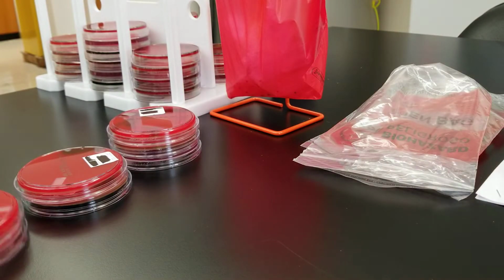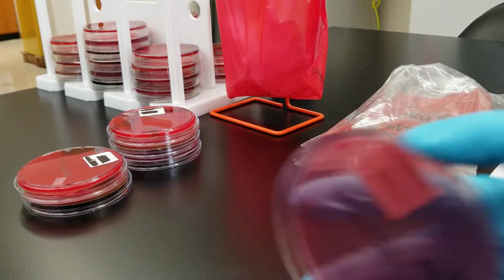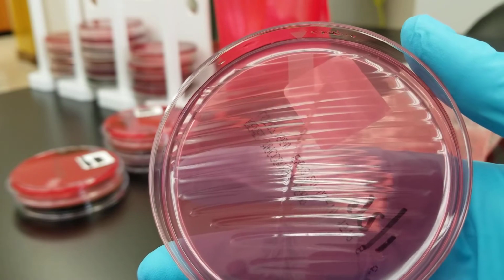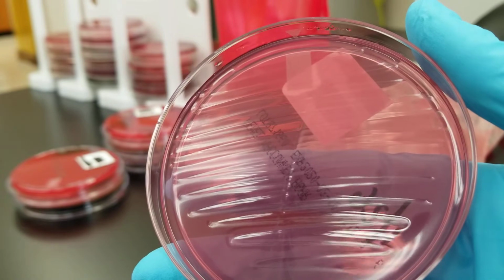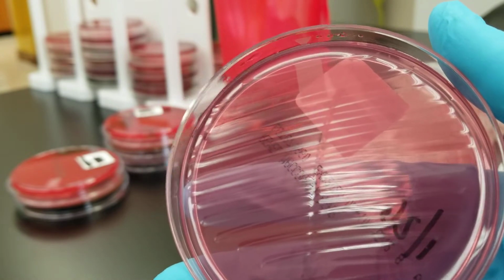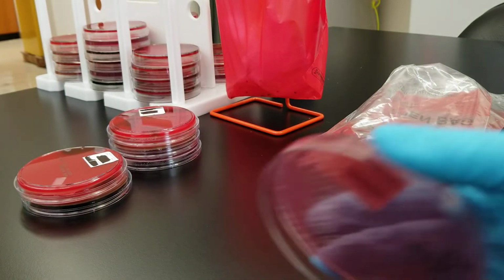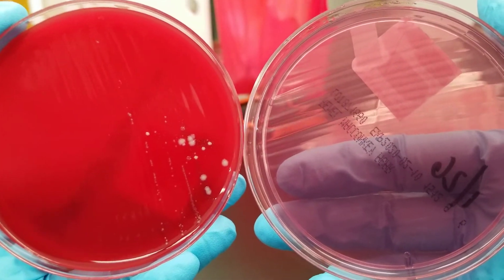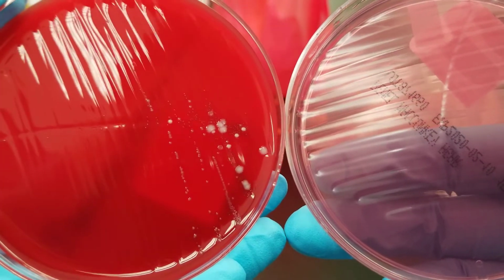Okay. Moving on, we're going to do a urine culture. So this one, you want to make sure to remember that you're streaking differently with the urine culture. You should be doing a line down the middle and then you're separating it all across to see if you are going to be able to isolate any organisms. So this is the primary setup. We have a blood agar plate and a MacConkey. Nothing grew on the MacConkey, but we did have a couple of organisms grow on BAP.